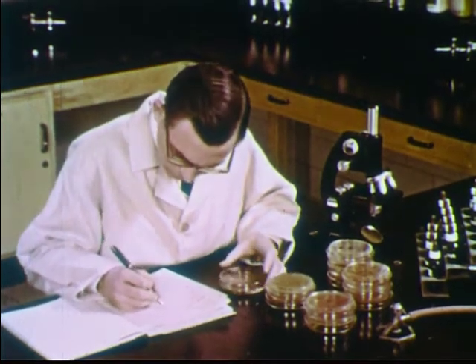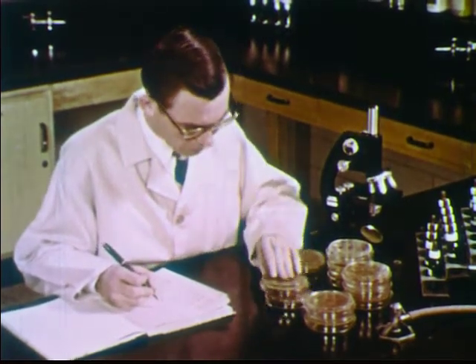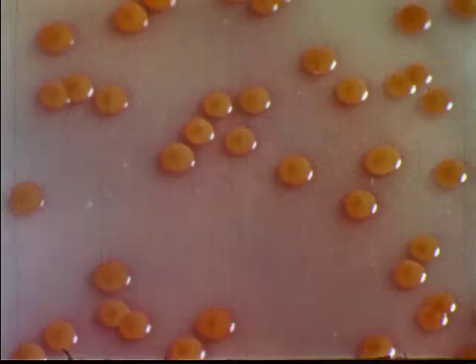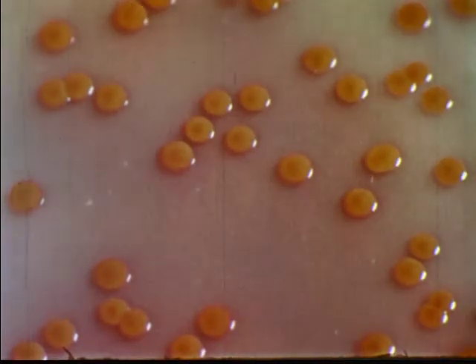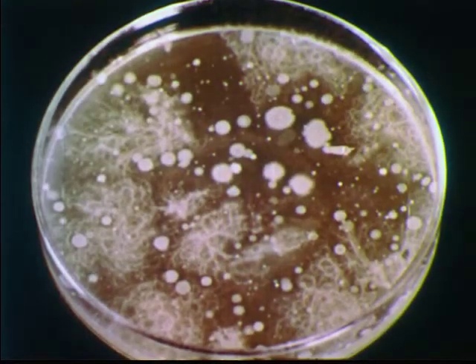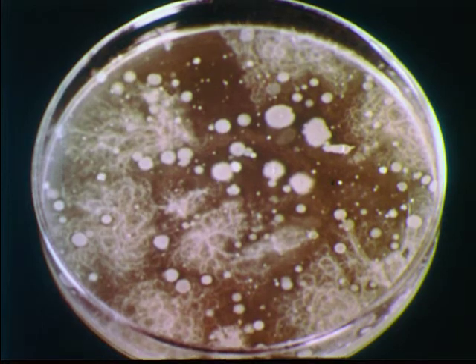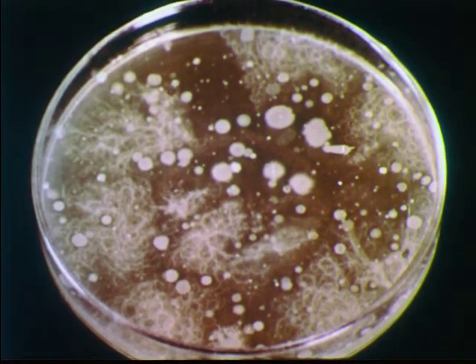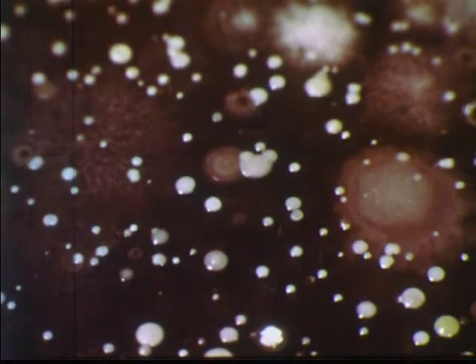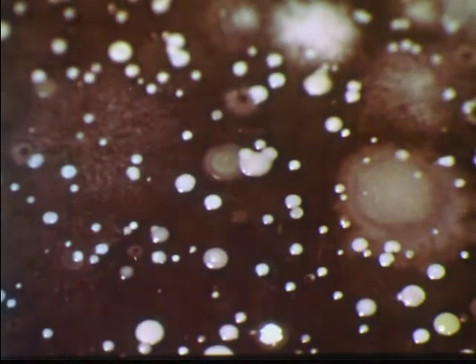In addition to microscopic examination, the characteristics of colonies are used for identification. Some bacteria produce colonies of specific colors; other colonies have unusual surface features. A variety of different colonies will be found on nutrient materials exposed to the air for a few minutes. Frequently on such a plate, colonies are found growing together. When a smear from a mixed colony is prepared and stained in a special way, different bacterial forms are observed — representing two different species of bacteria. It is possible to separate these forms and to grow each one individually.